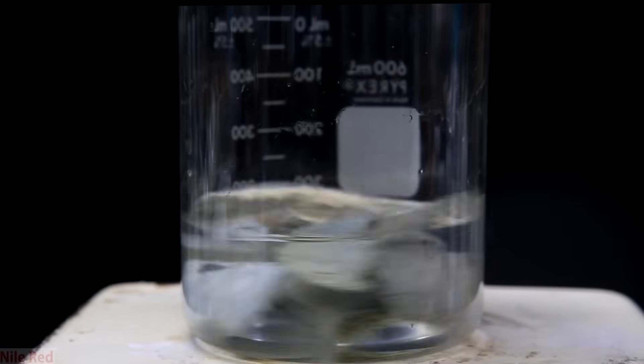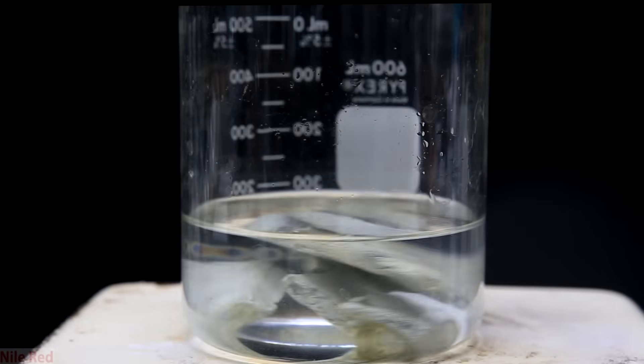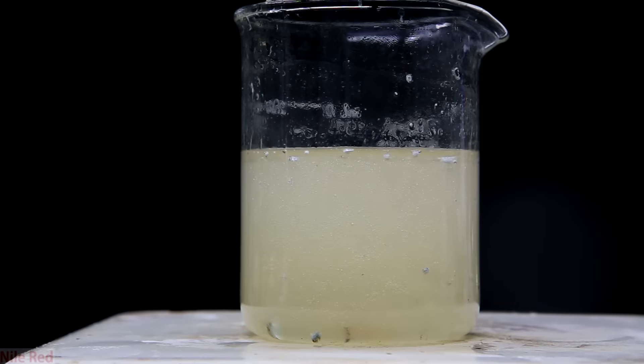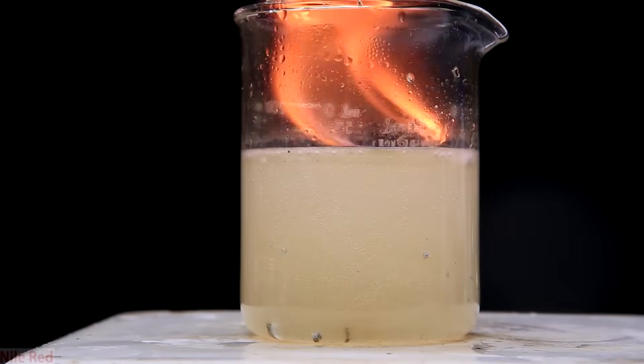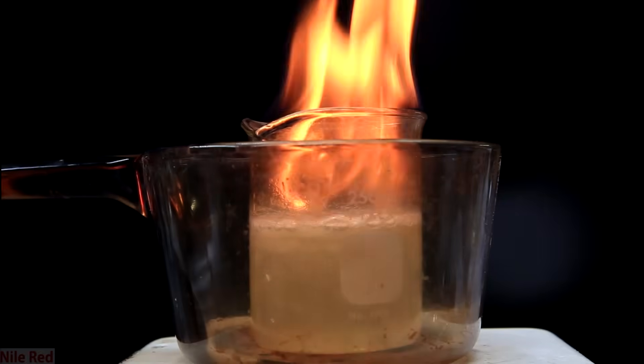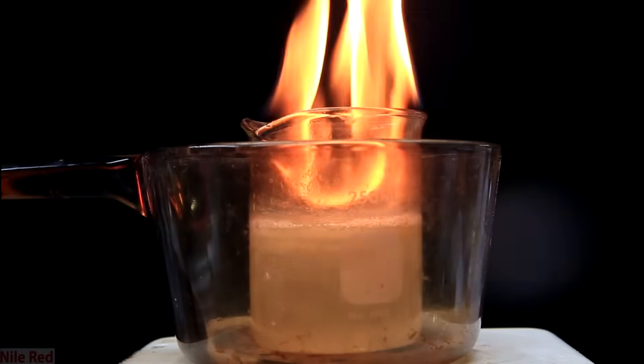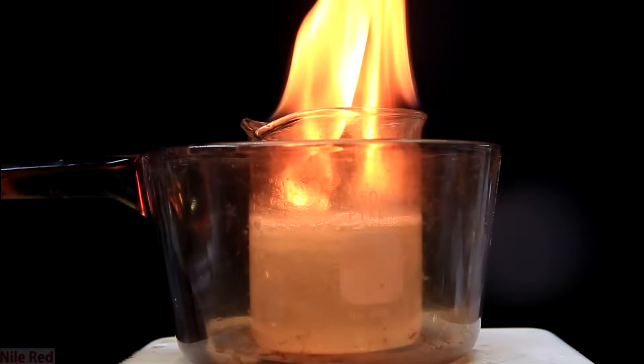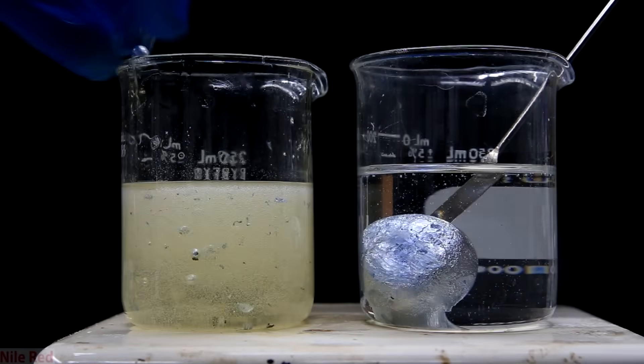This small amount of boiled potassium metal escapes and the moment it touches moisture or oxygen in the air it ignites and reacts explosively. This can have a chain reaction and your entire piece of potassium could light on fire. When I say explosion it makes it sound like a bomb is going off, but only a very small amount of potassium is vaporized. So there is a violent reaction, but it's small enough that it's not like it's a bomb, and it leads to a very undesirable potassium fire.